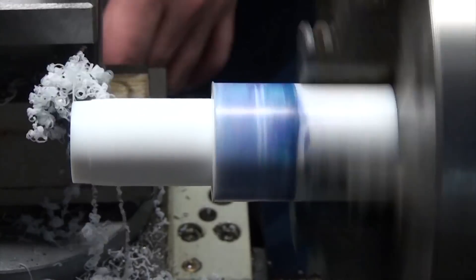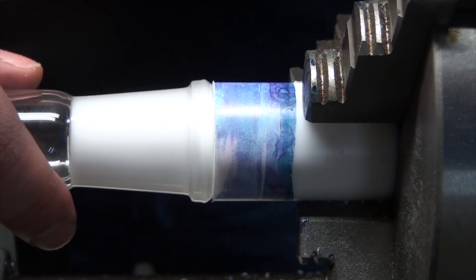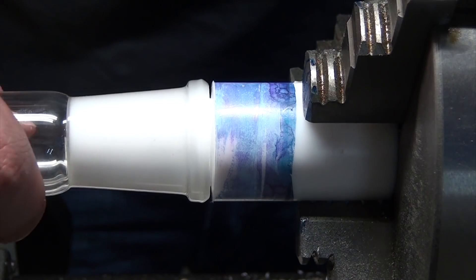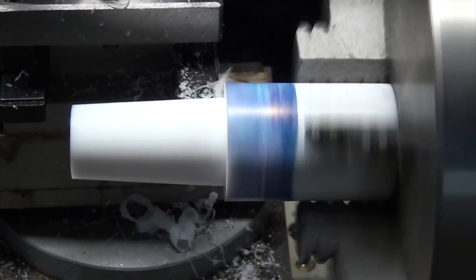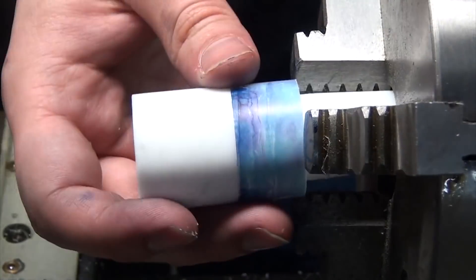Of course, I ended up overshooting a bit while I was cutting the taper, so I had to fix that by trimming things a bit. This was a recurring problem where the rim of the glassware was bumping into something preventing the cones from coming into good contact with each other. So by removing the blocked area, the cones could come into contact and seal properly. Once that was fixed, I turned everything around and could trim the part to length.